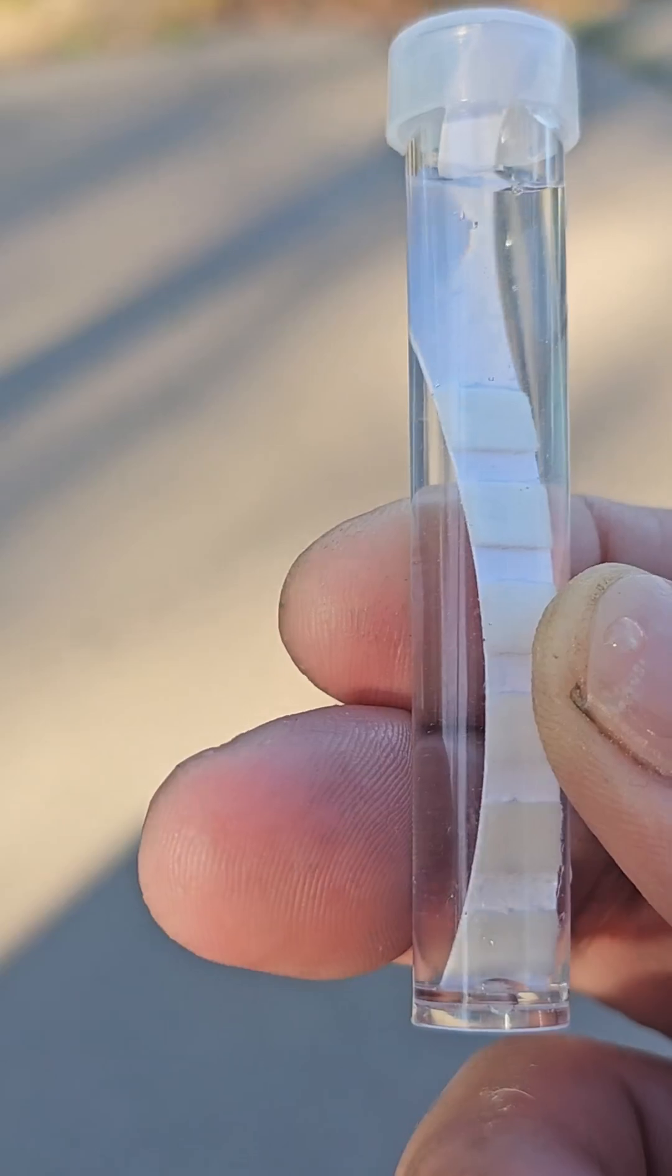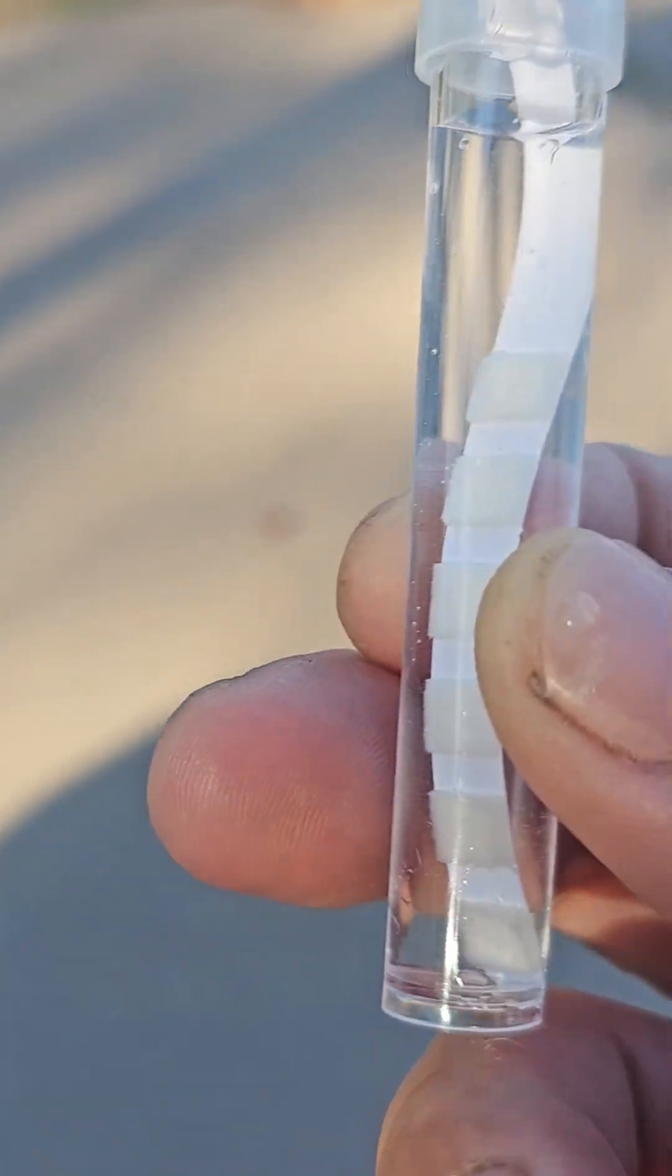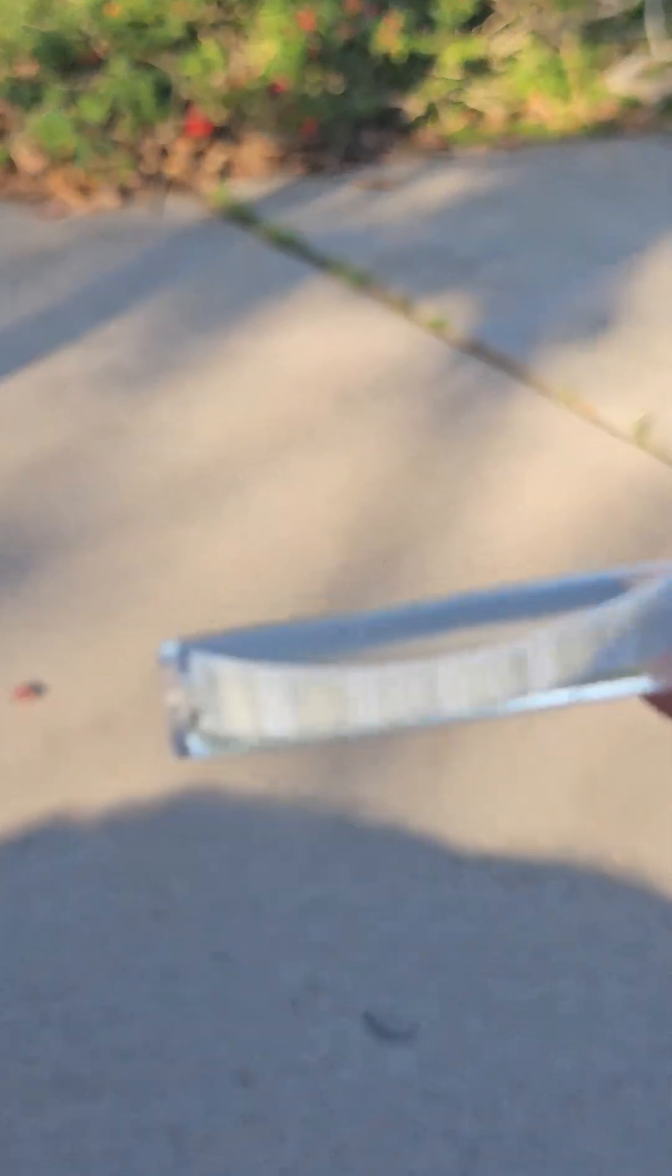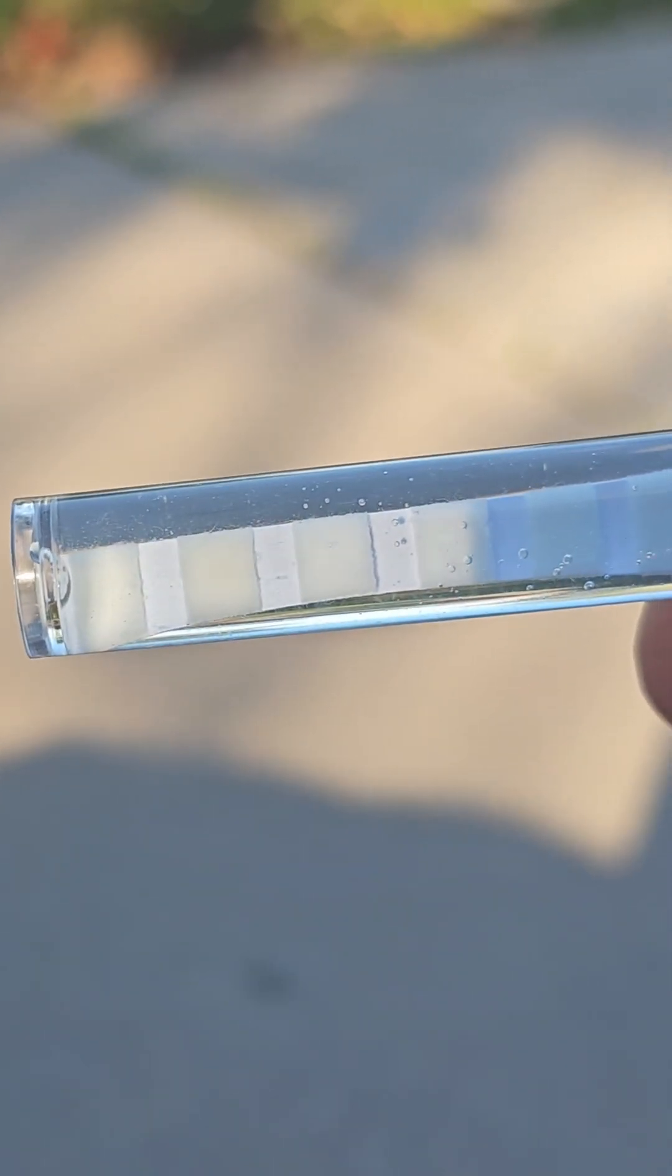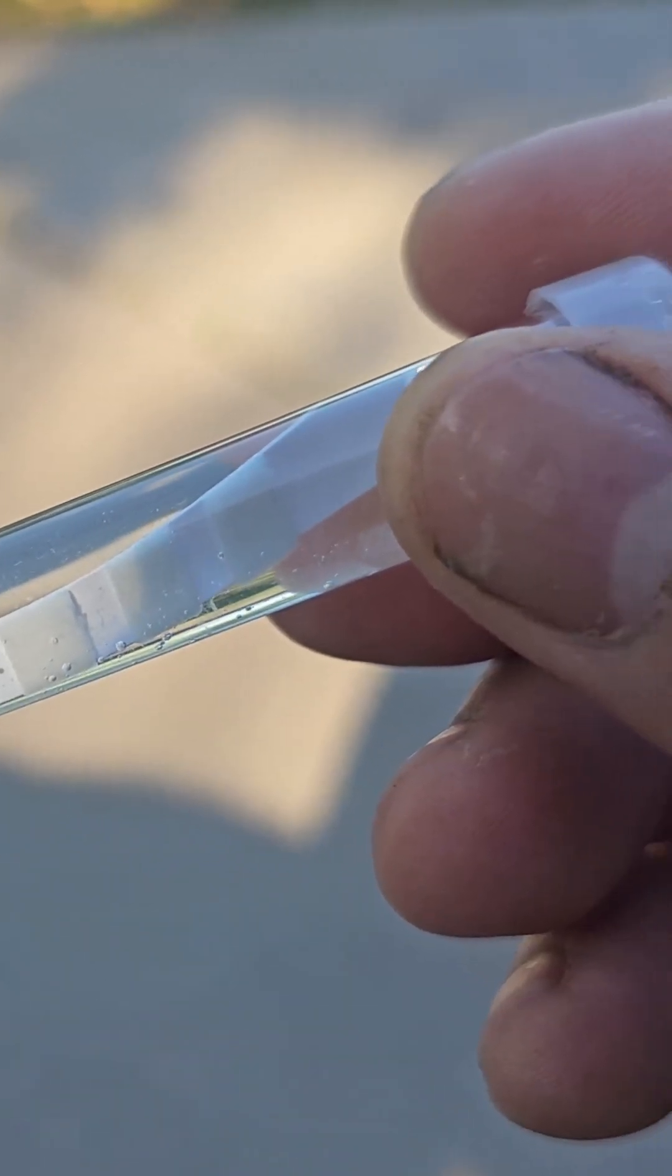You have to wait for two minutes, take the strip out, and then compare it to the actual list that's included with either on the case or on the cardboard. As you can see, it's been almost two minutes, about 10 more seconds. We're going to take this out.